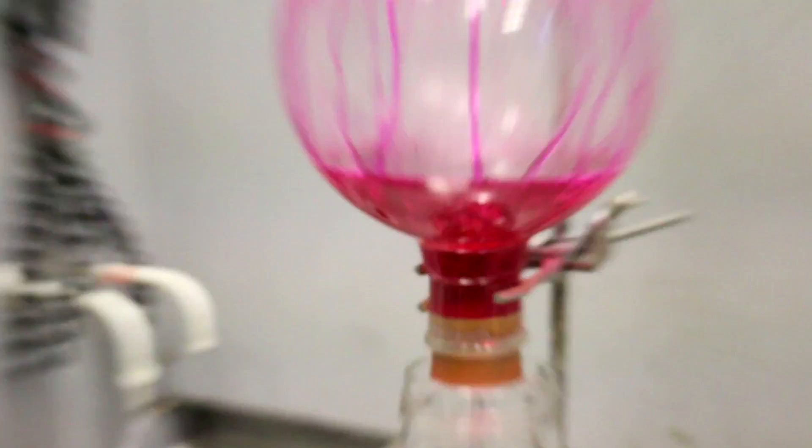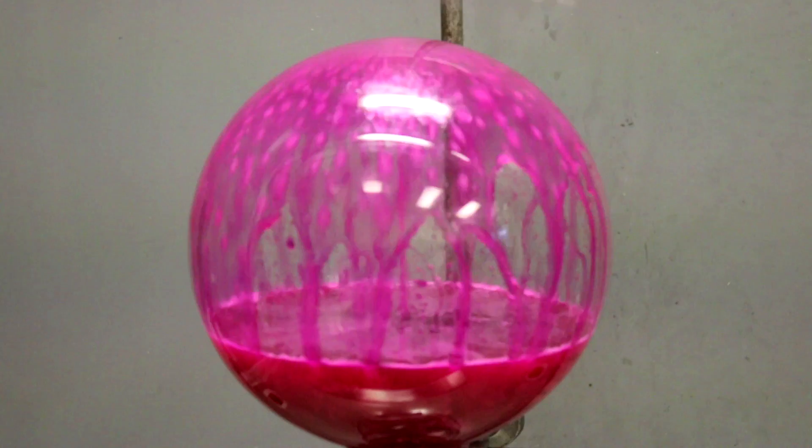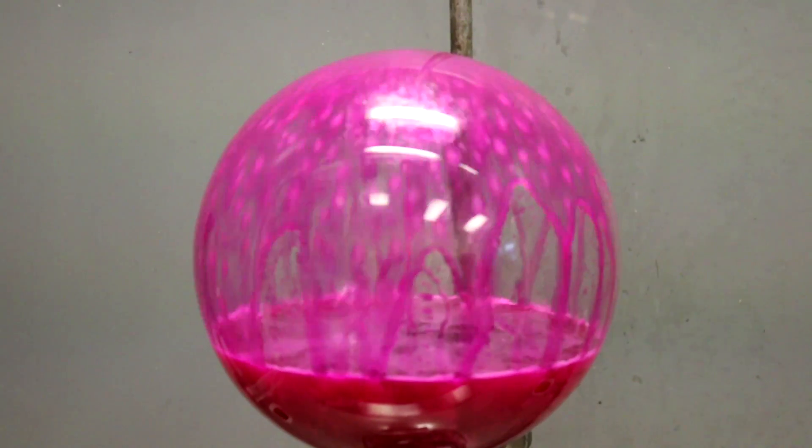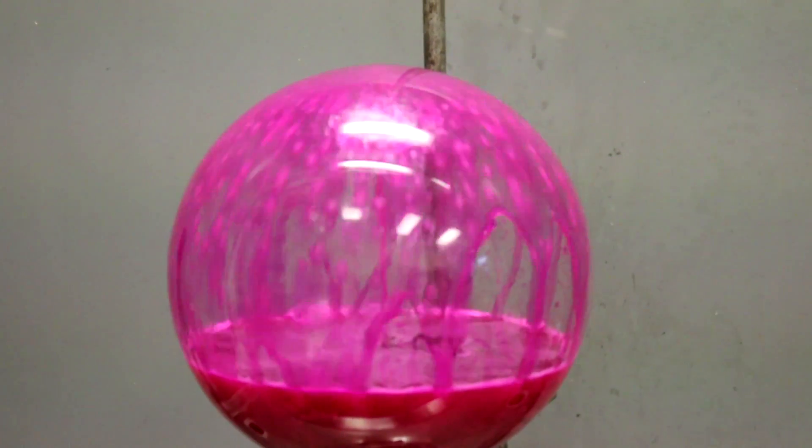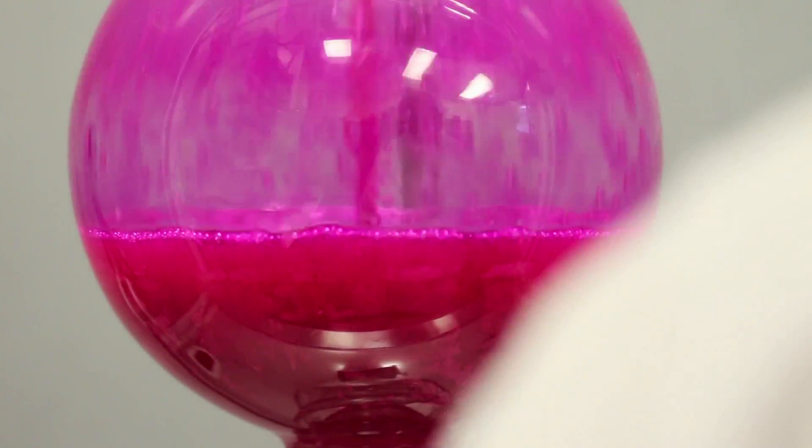For reasons that I don't quite understand, as it went on, the form of the liquid film that was on the glass surface changed a bit. So there were ever-changing patterns. And also, the color of the indicator changed quite a bit. So it was really nice.